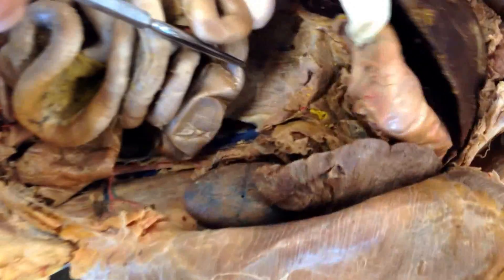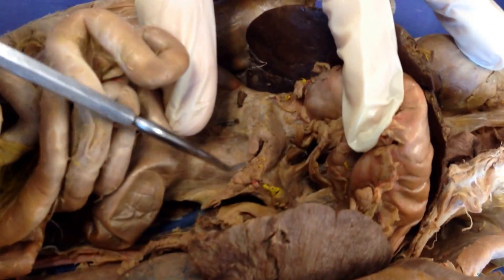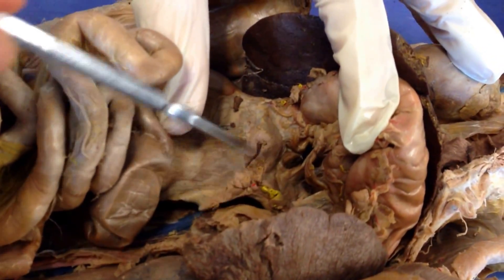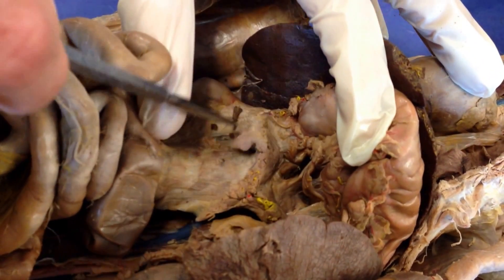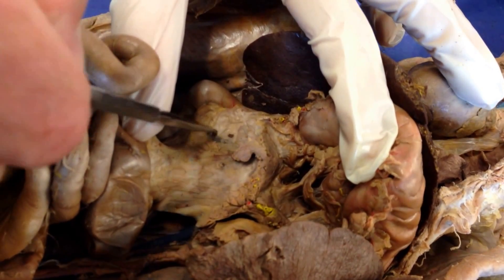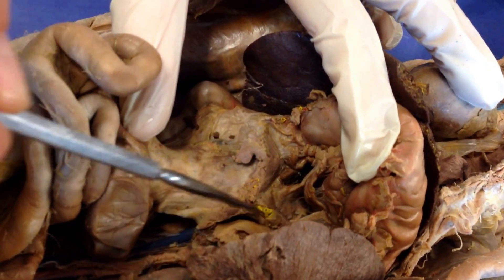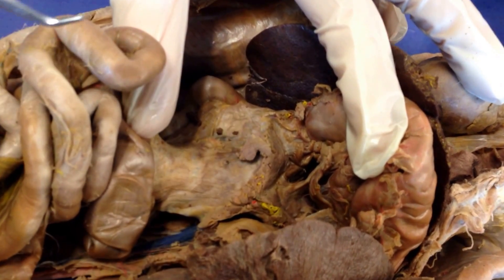Underneath the stomach we have the pancreas. The pancreas isn't as easy to see in this one as it will be in some of your cats, but this brown piece that goes around here — some of it wraps around inside a little bit. It's not the greatest example of a pancreas, but it's not too bad.